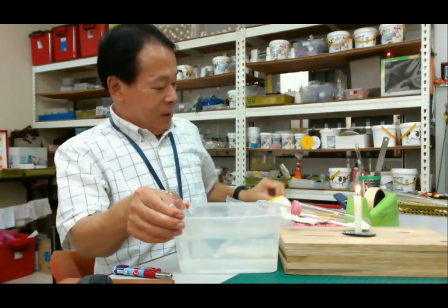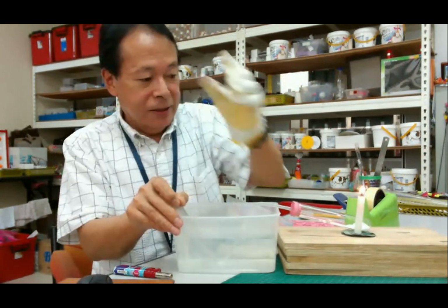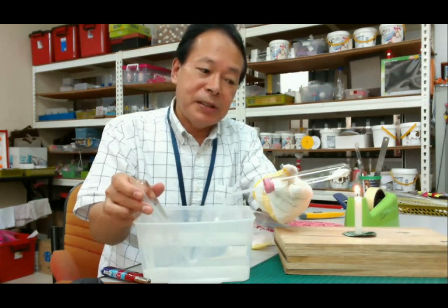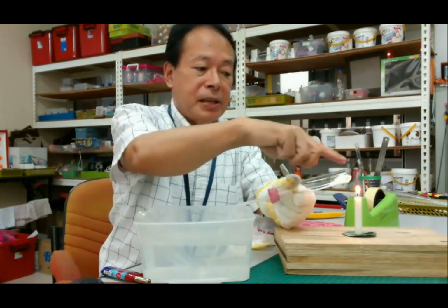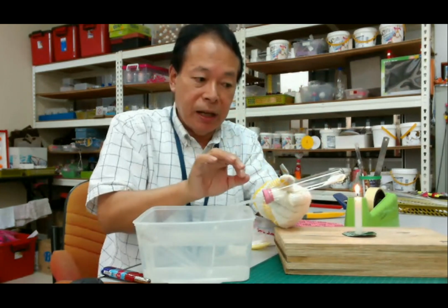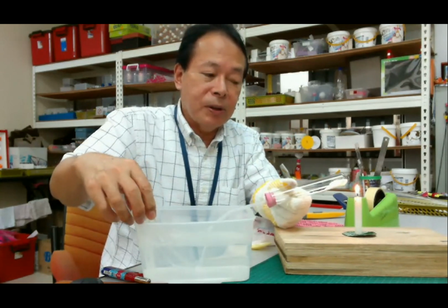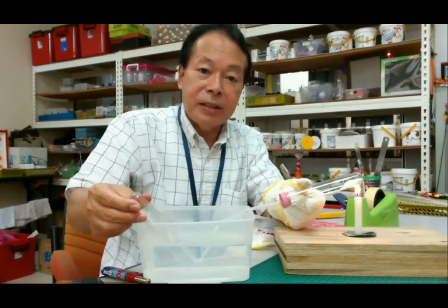Then cover the glove with my hand, with my finger. Okay. Then start heating. Okay. Then this time, please incline the test tube at this angle. This side is a little higher than this side because this chemical reaction produces carbon dioxide and water. If water goes back to the heating place, the test tube may crack, so it is a little dangerous. So the water must not go back to the hot place. So incline at this angle, then start heating.